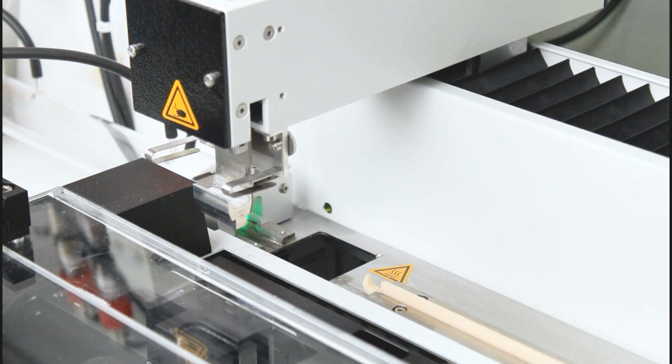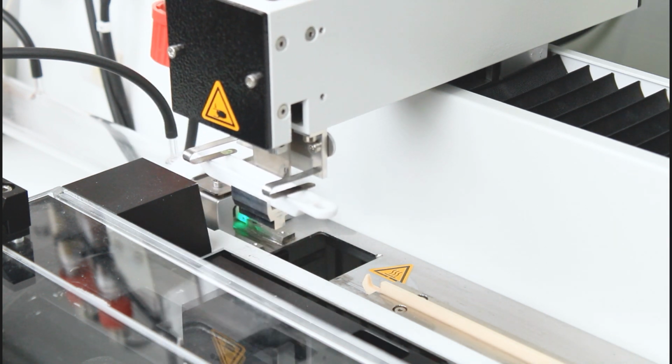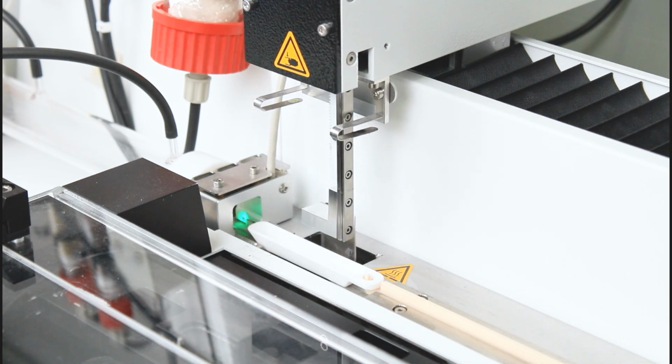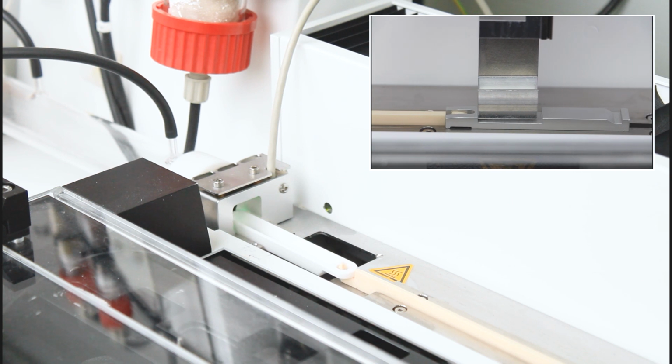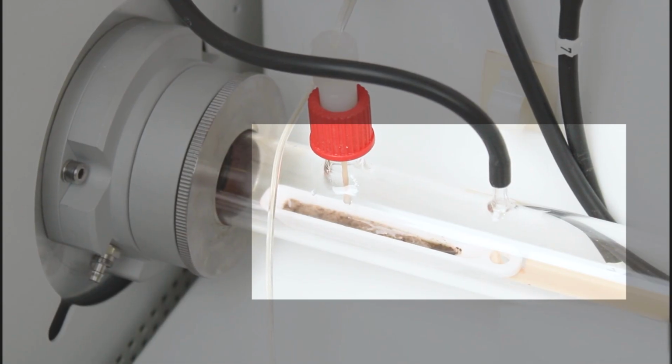automatic module. Hereby, the ceramic boat is placed onto the ceramic hook for sample feeding. Phosphoric acid is dosed automatically onto the whole sample for TIC determination. A fast TIC measurement is achieved at 80 to 100 degrees Celsius.